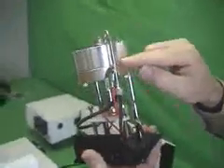You want the end of the anode cooler to be flush with the end of the lamp, and also the anode cooler to be right down the center of the notch in the reflector collar. The reflector collar is this gold collar at the back of the reflector.